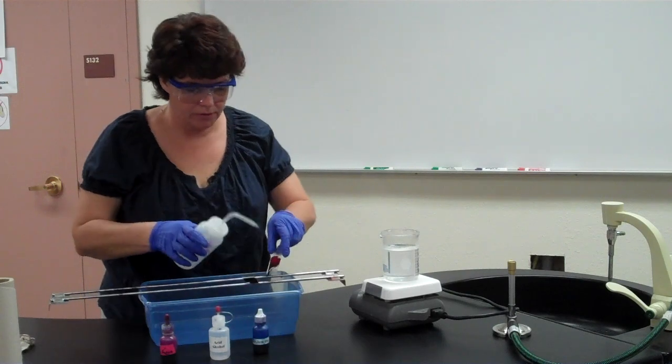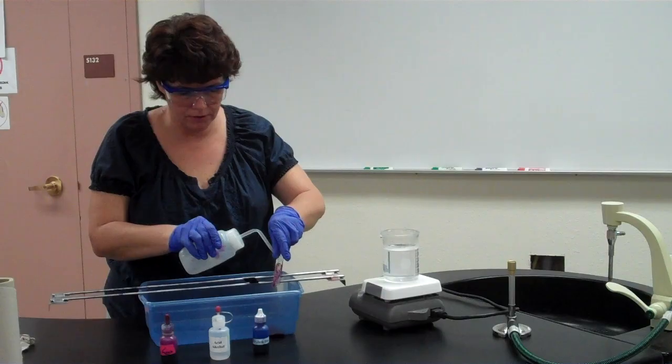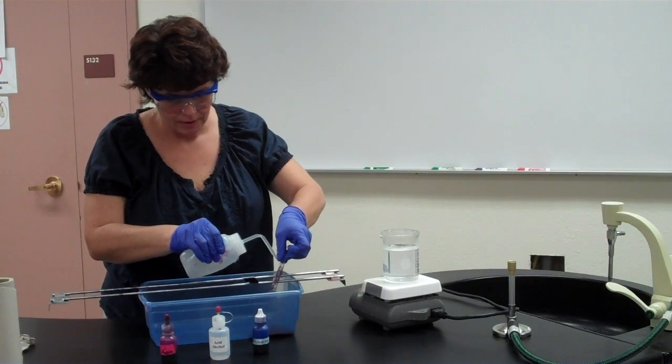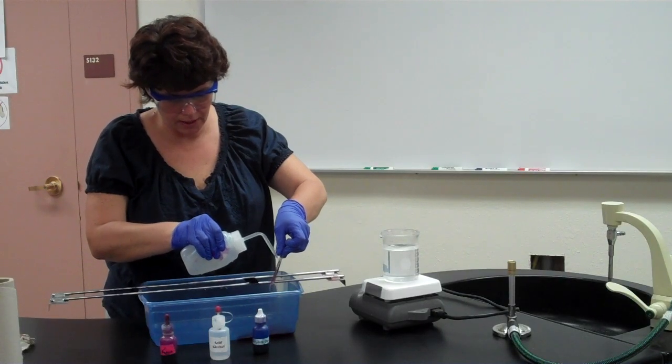Now I'm going to rinse, just like we do. We always rinse with water between every step. So I'm going to rinse that off. And just keep rinsing. Don't be afraid to use too much water. It's okay, right?